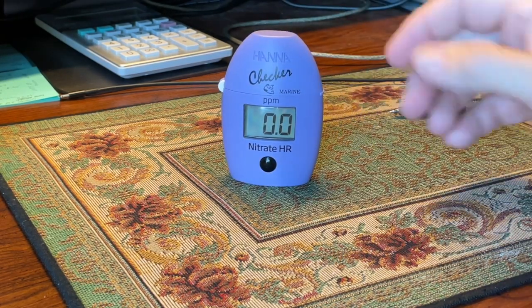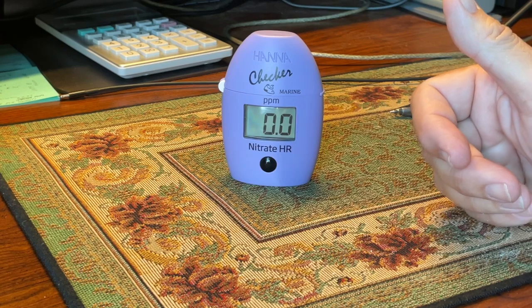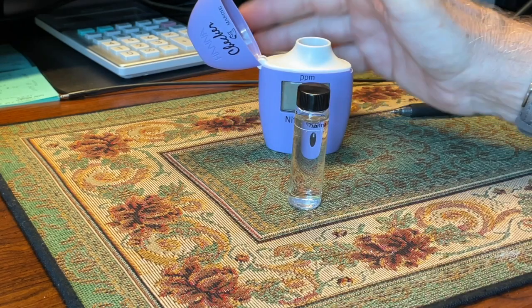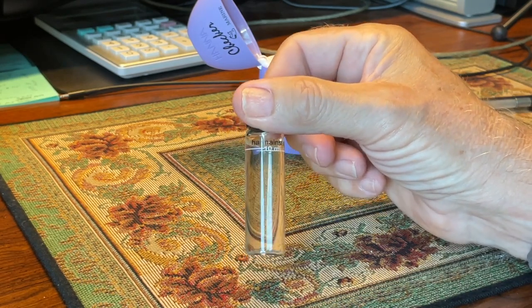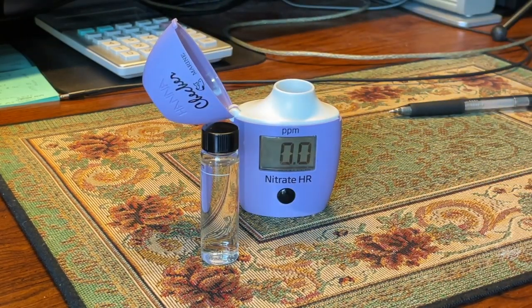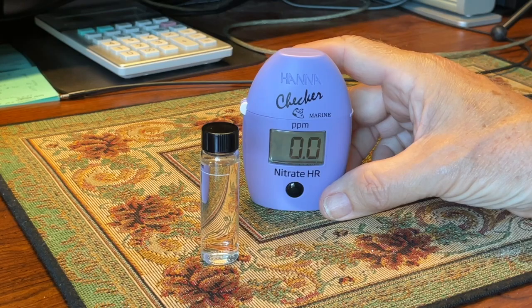Water right from the antique aquarium is reading zero nitrates. For the people who say the anoxic filtration system doesn't work — it depends on a lot of things, and here is a case in point where I did the test right in front of you. I'll be more than happy if anyone wants to come over and have me do a test in front of them — that's what I'm reading. The crypts are doing well too.